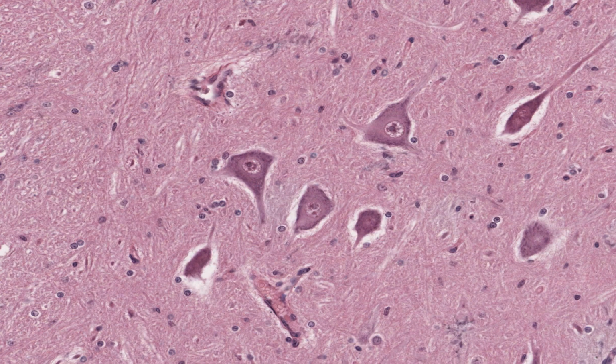Motor neurons in the ventral horn are well preserved with a pale nucleus and a prominent nucleolus, and Nissl substance occupying much of the cytoplasm, as you saw in the previous section of the spinal cord. Again, about all that you can see of glial cells are their nuclei and a region that stains paler than the surrounding tissue, or a tiny clear rim of what would have been cytoplasm.